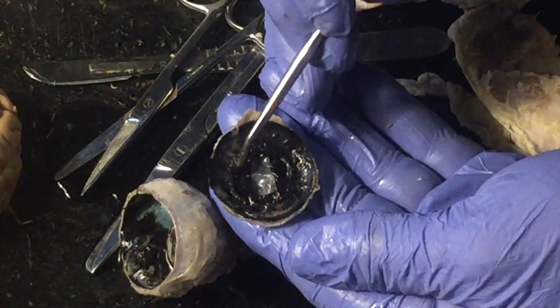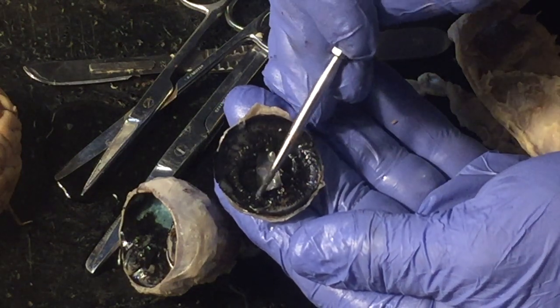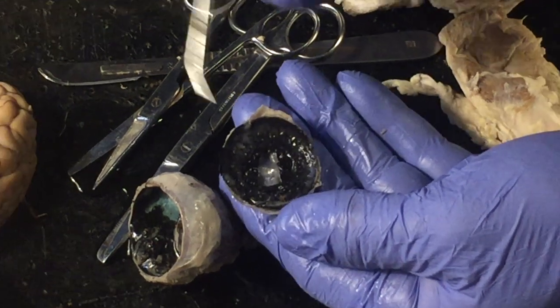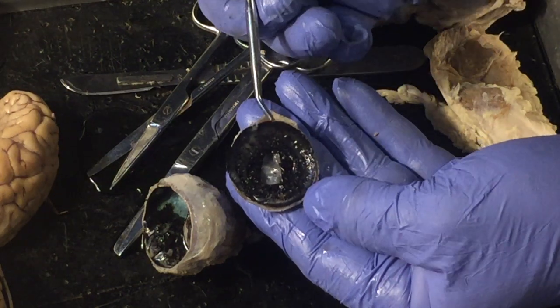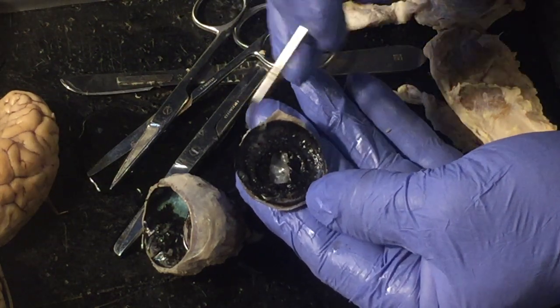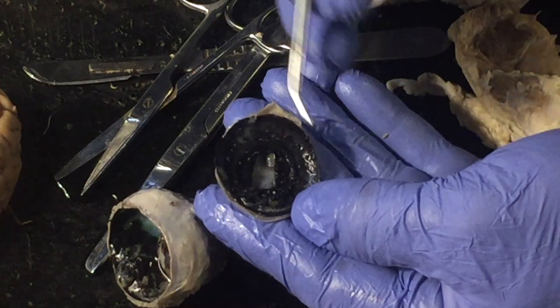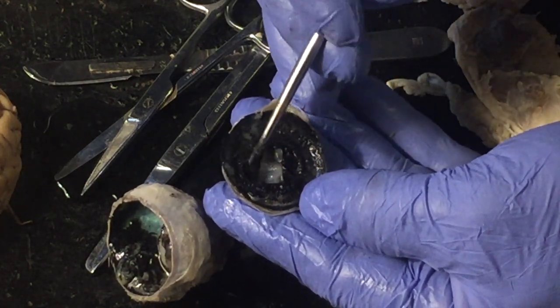Okay, and if we could look at this microscopically, we would see circular muscle making up this black portion we call the iris. If you think about what happens when you come from a dark room outside, that pupil shrinks because you're all of a sudden bombarding the back of your eyeball with all that light, and it doesn't like that much light, so it closes down the size of the circle, the opening here, the pupil, to let less light in. That's achieved by these circular muscles that make up the iris.